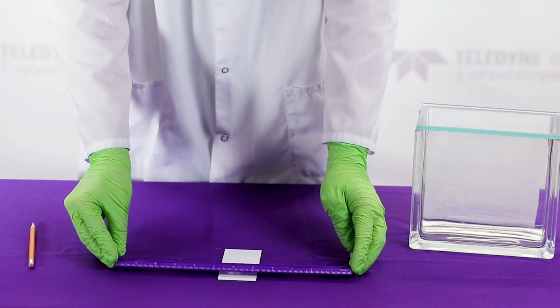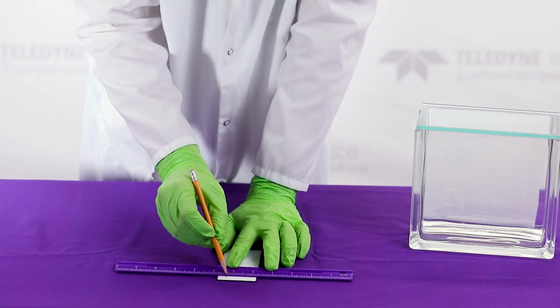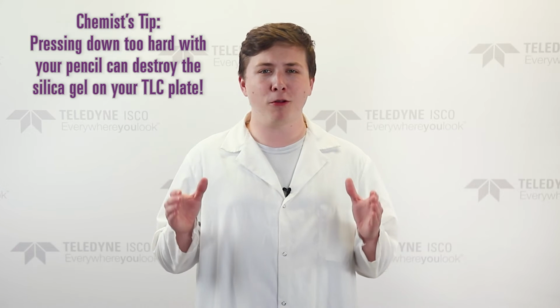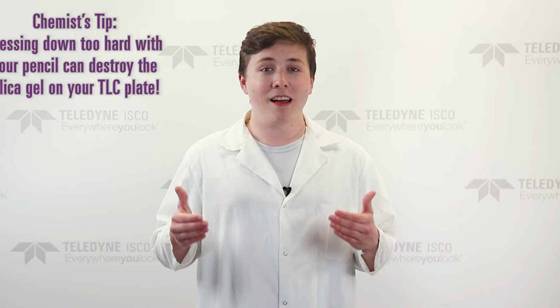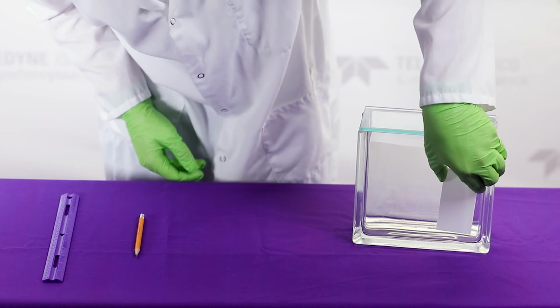Mark a line on the glass plate using the straight edge and pencil so that the line sits just above the solvent level inside the developing chamber. Be careful not to press too hard with your pencil or you run the risk of ruining the plate. Again, make sure the line is above the solvent level when you place your glass plate into the developing chamber.